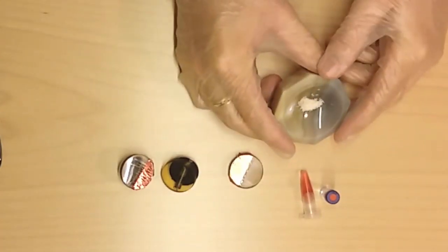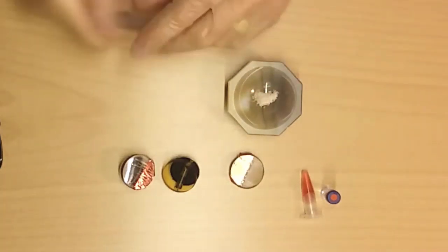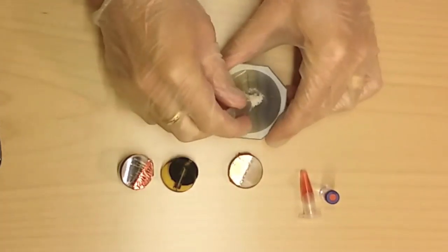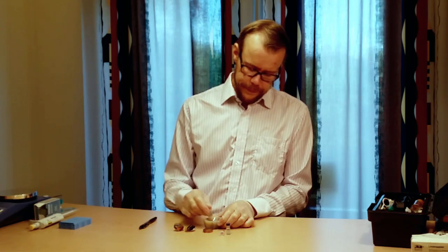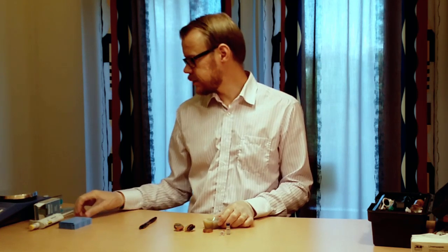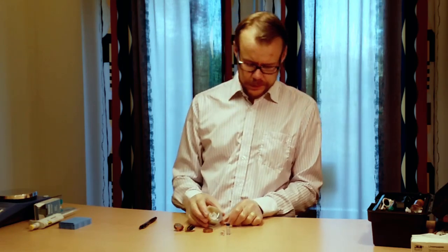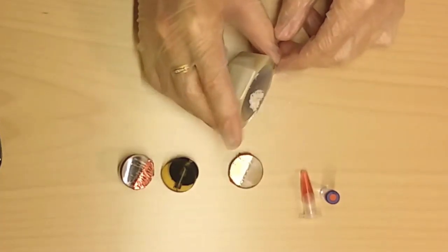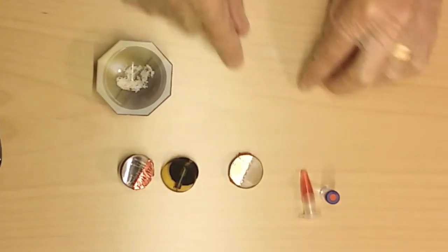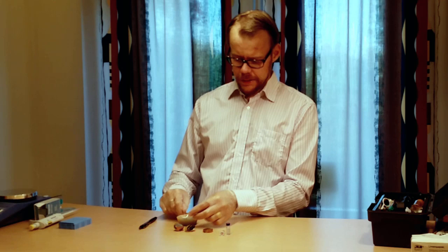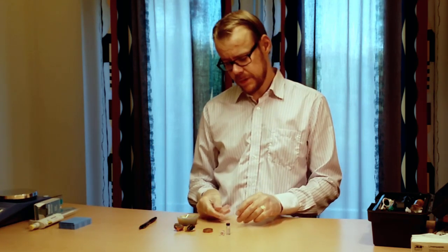If you have, for example, a powder-based material like this, what you can do then is to grind it down. It can be very easy. And when you have done that, what you do then is to take a small glass slide from a microscope like this. You pour it out like that. And then you have very excessive amount of powder onto this glass slide. You pull it back into the cup. And the thing that's left on here that you can't see, that's enough to make transmission electron microscopy.